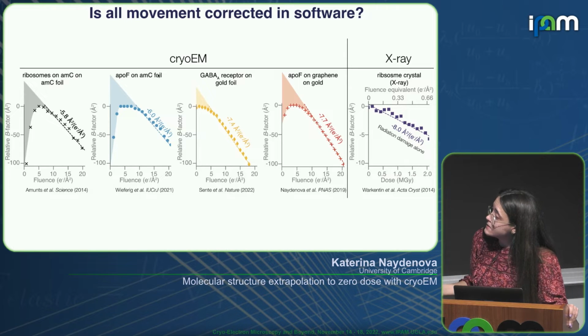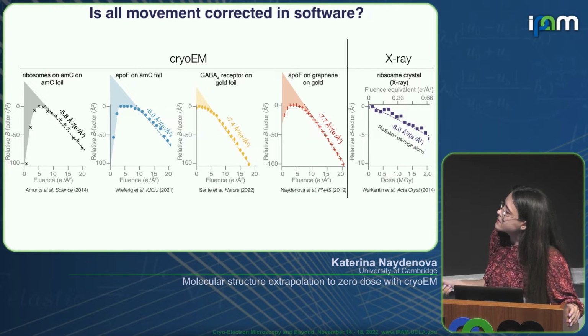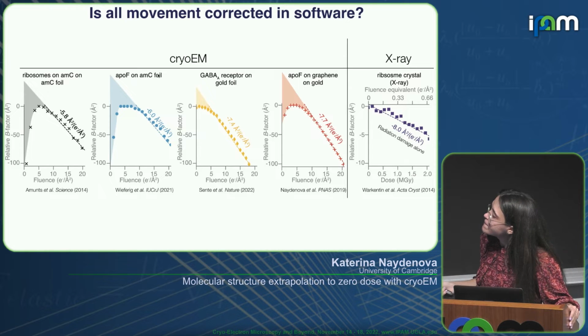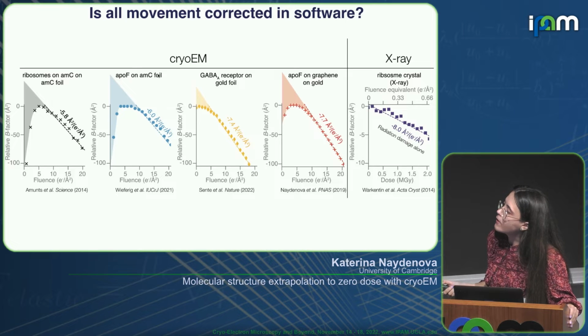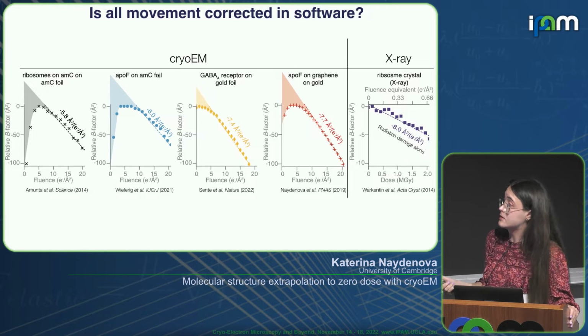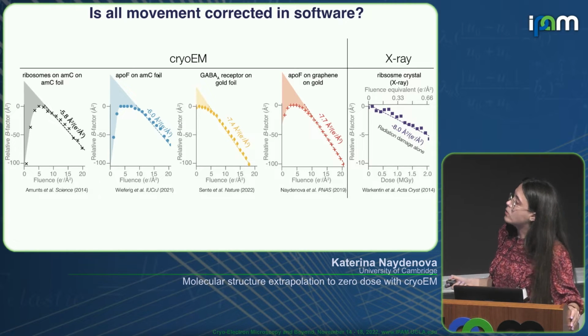But one thing remained invariable: the quality of the data at the onset of the irradiation is always lower than this linear trend that we expect from X-ray crystallography, where the quality of the data decays purely due to radiation damage. So if we were able to take account of all the specimen movement computationally in our cryo-EM data, all of these plots should have been straight lines, which they're clearly not.